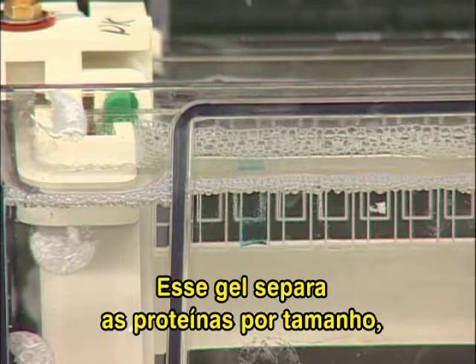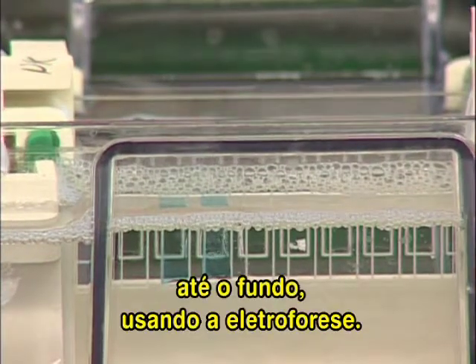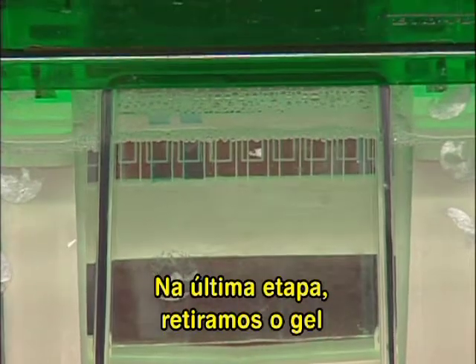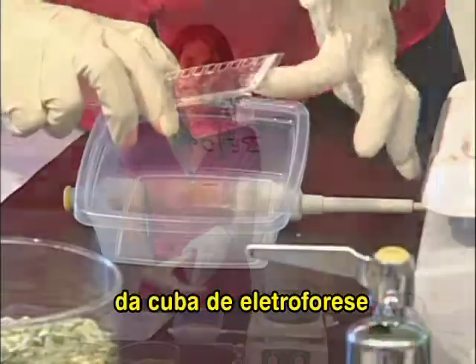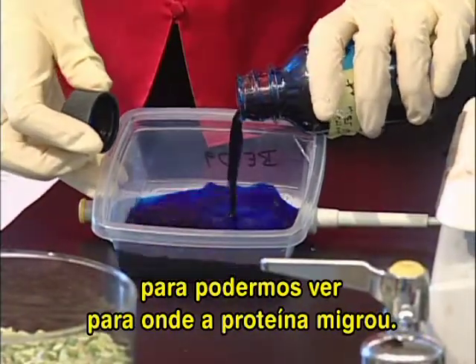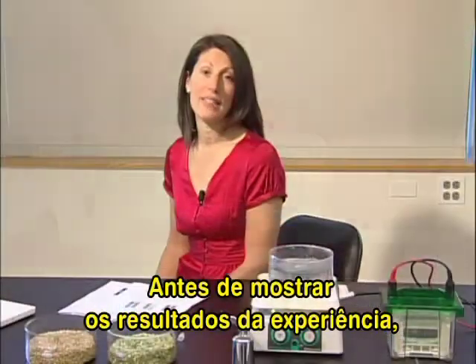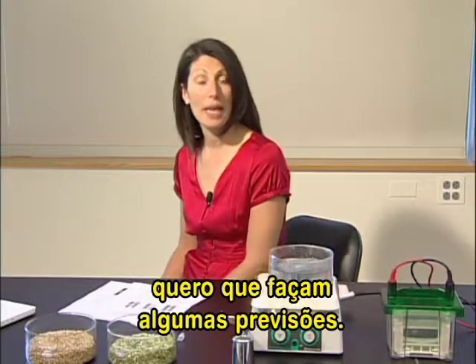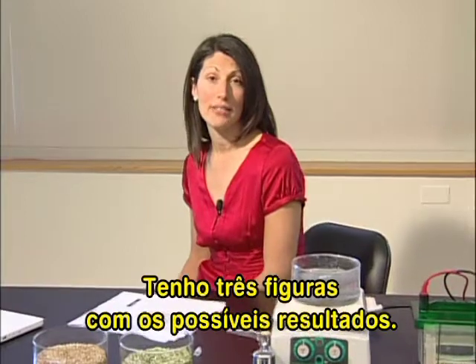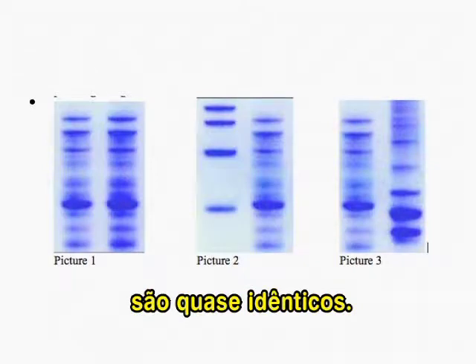The protein gel separates the proteins by size, with the smallest proteins moving fastest through the gel and to the bottom using electrophoresis. And in the last step, we remove the gel from the electrophoresis chamber and mix it with a dye, Coomassie stain, that will let us see where the proteins have moved through the gel. And before I show you what the results of this kind of an experiment might be, I'd like you to take some time to make some predictions. I have 3 cartoons for possible outcomes from this kind of an experiment. In the first cartoon, the 2 blue staining patterns look almost identical.